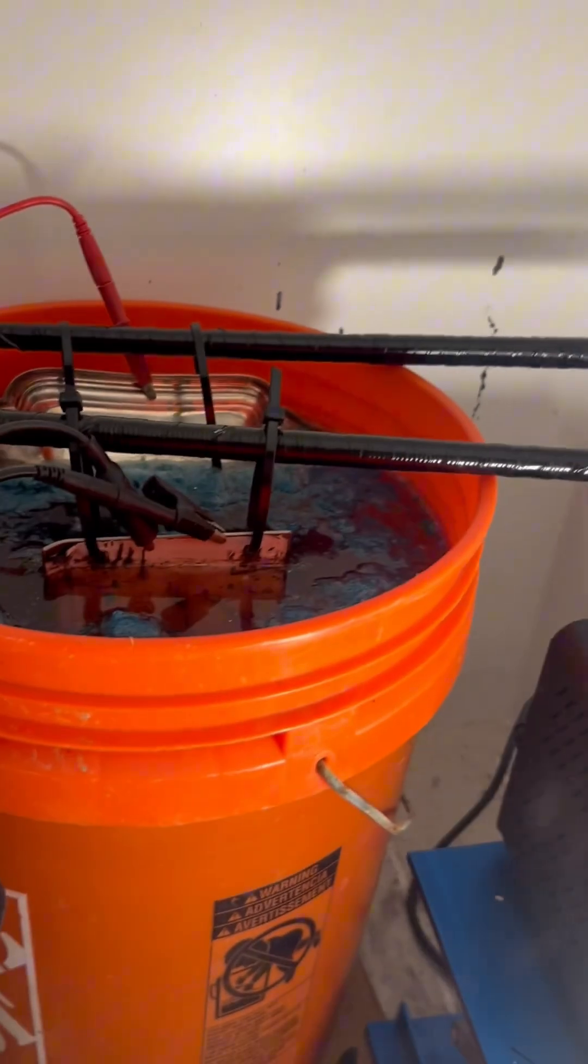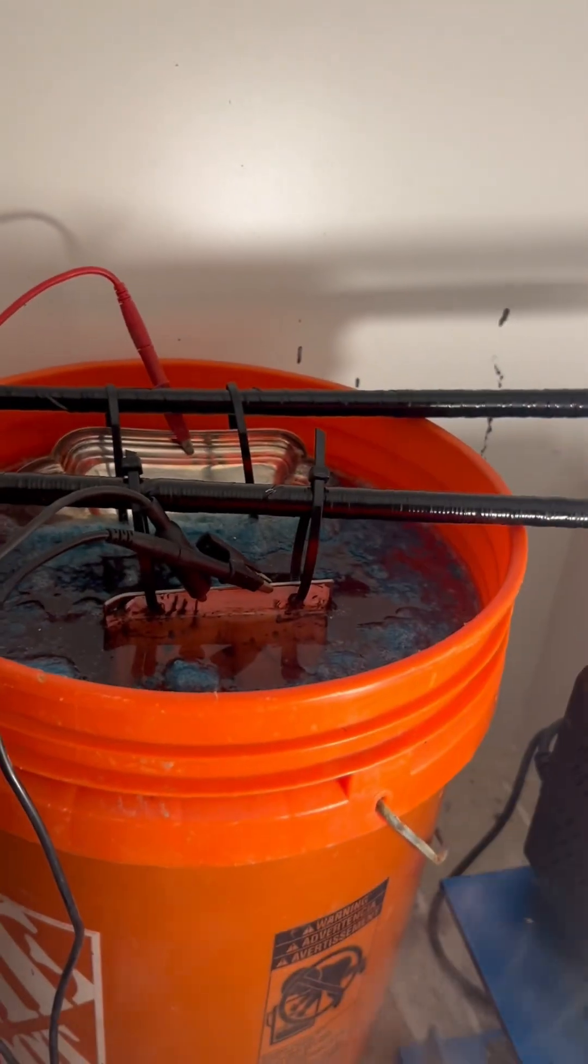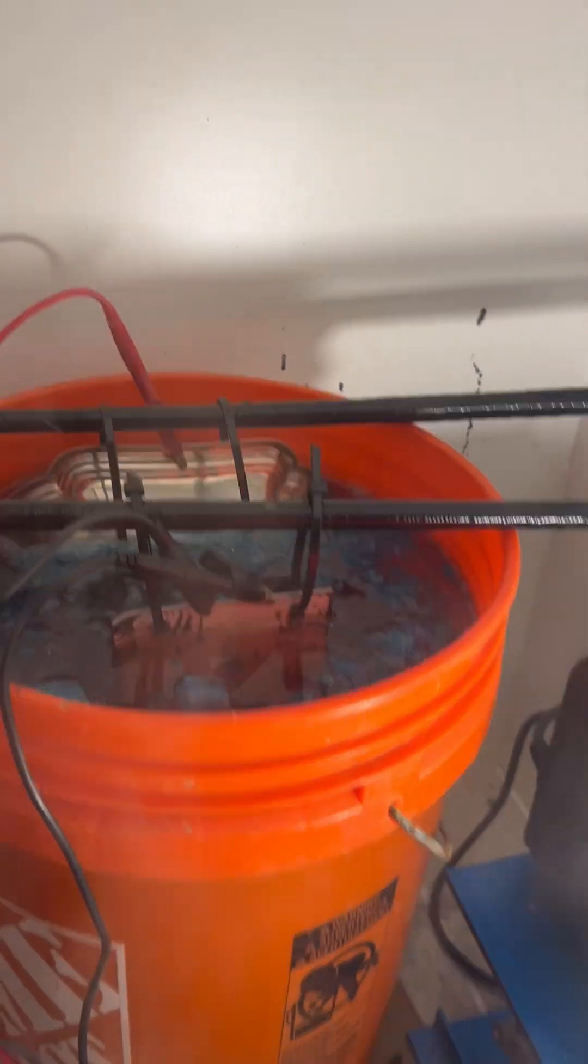It was a good experiment. It probably works on spoons and smaller stuff really well, but you can remove silver with just water. Not efficient, like this silver stripping cell.